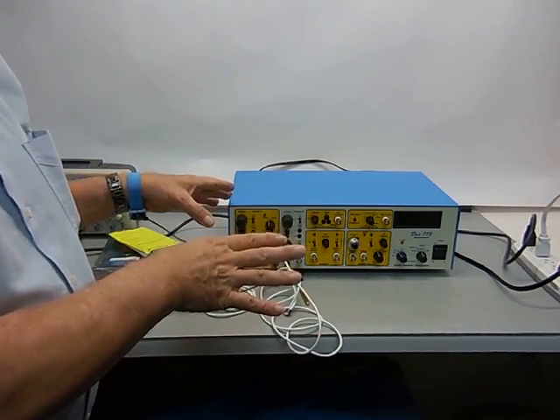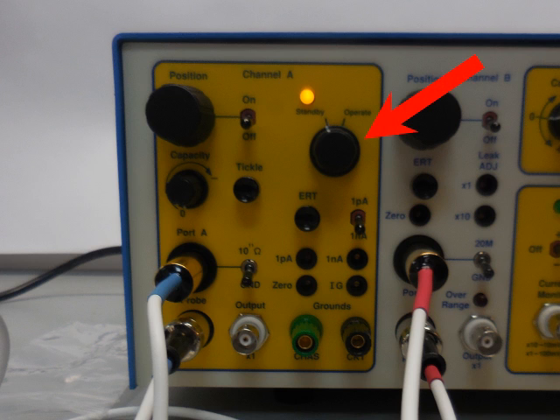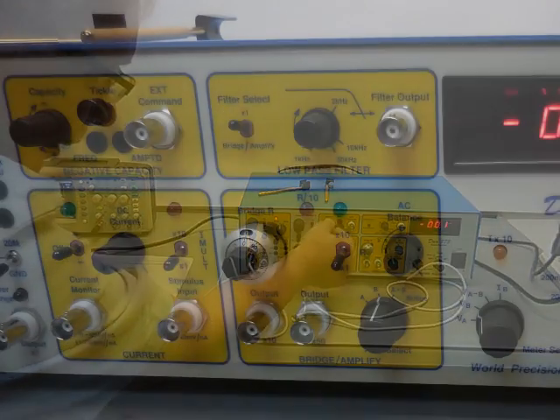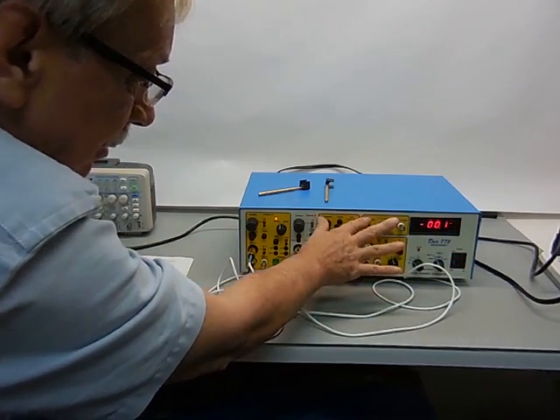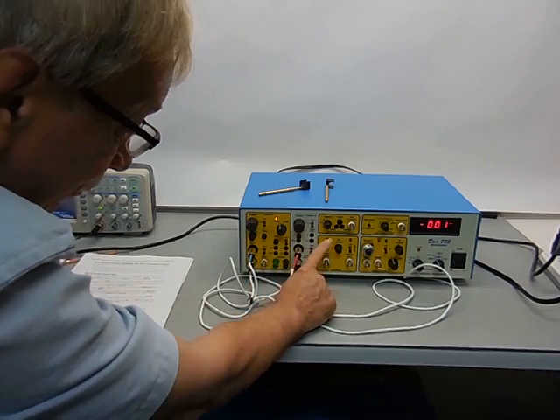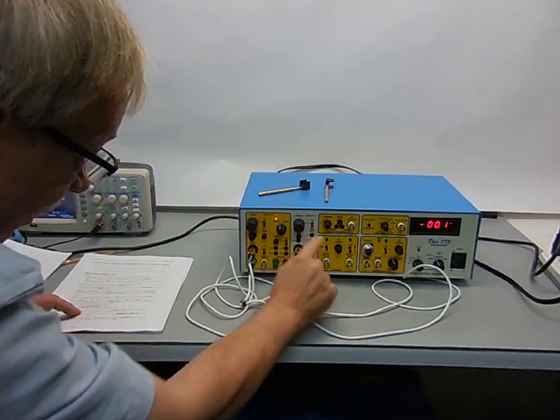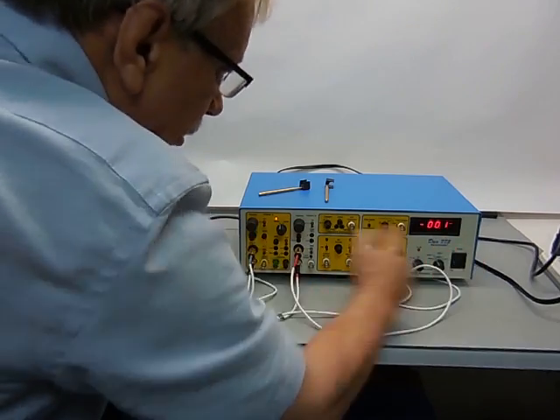Reading from the manual, the default conditions are: A channel in standby mode, capacity compensation knob all the way counter-clockwise. In the B channel, both position switches are off, capacity compensation set to zero. In the current section, this is turned off. Times one, times one over here, filter is on times one. Both of these switches - this is in the one nanoamp position in channel A sector. In the B sector, we have the switch set to ground, and in the A sector we have the switch set to ground. These are the normal default conditions for setup.